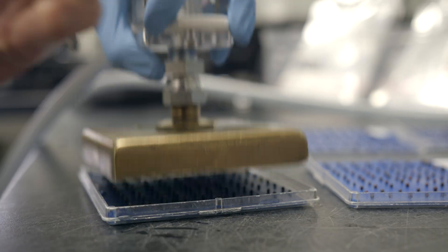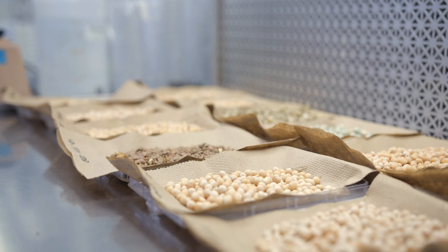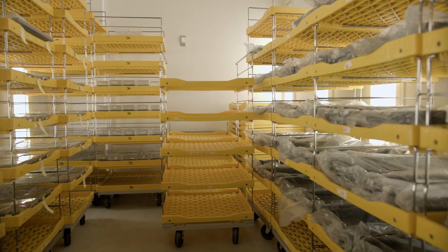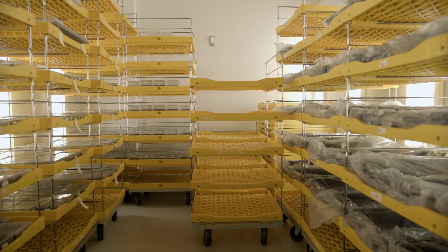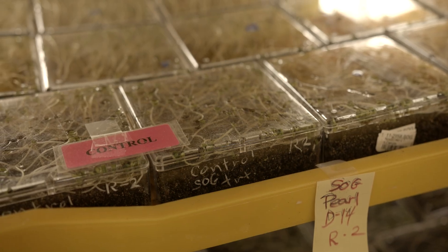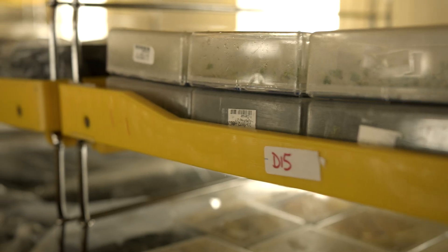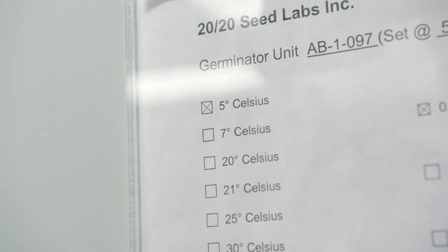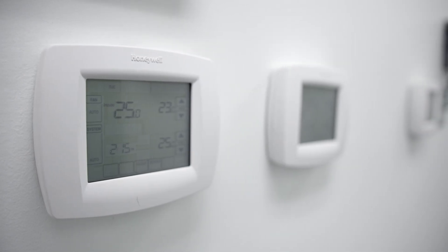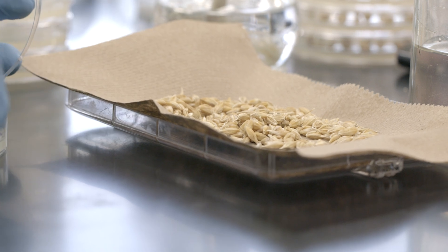Canadian germination requires testing of 200 seeds in ideal conditions in the growth chamber to ensure optimum germination, as there is no stress imposed on the seed. All variables such as light, moisture, and temperature are strictly controlled to ensure the only variable is the seed itself.